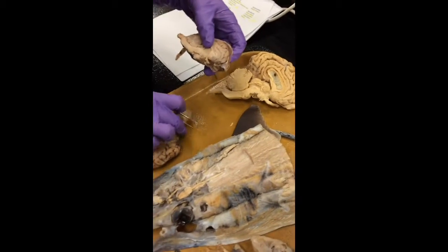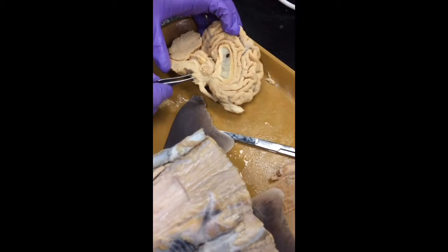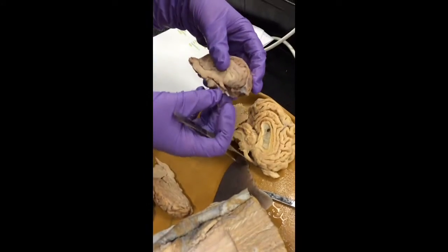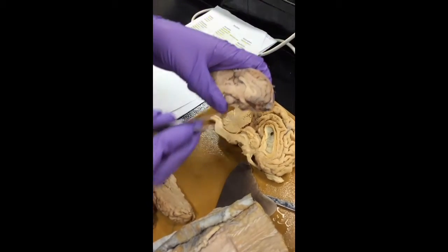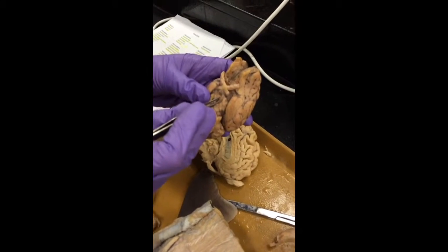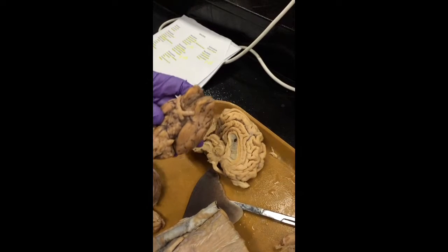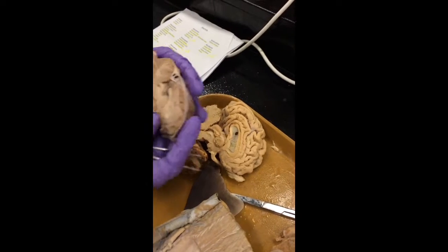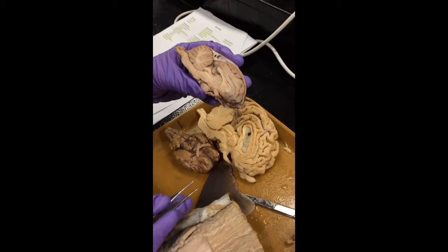If we're looking inside here, the mammillary body, here it is on the cow. If we're looking at a sheep, it's not as big, but it's right here. You can also see it looking like this. Your mammillary bodies would be right here. They're just kind of squished down in this one. The intermediate mass, or massa intermedia, it almost makes this nice circle right here in the middle.